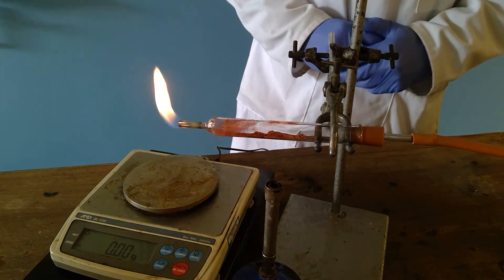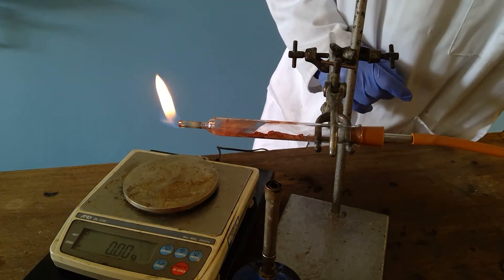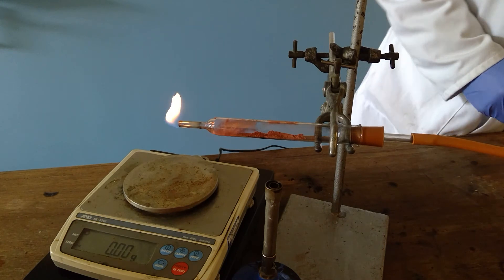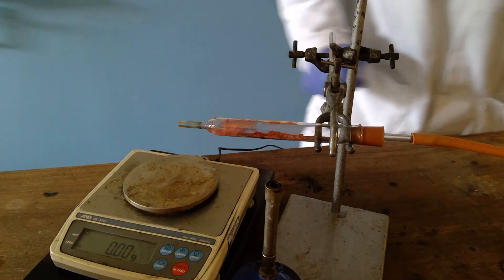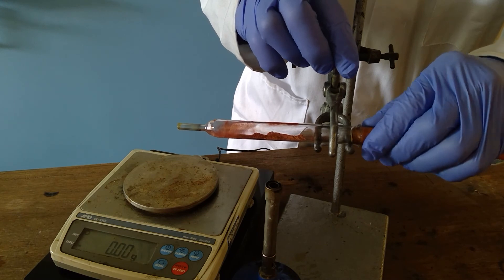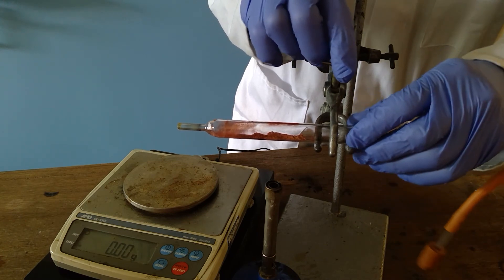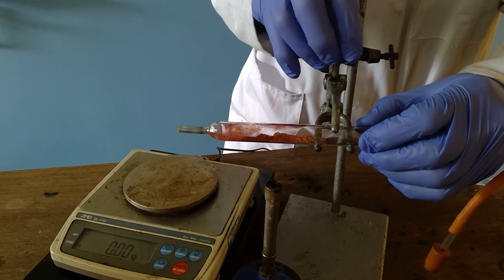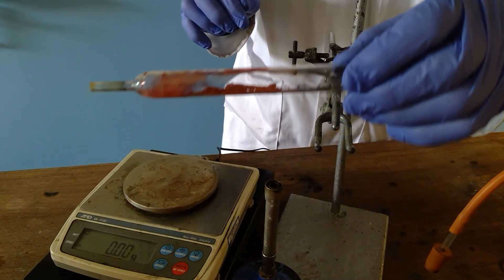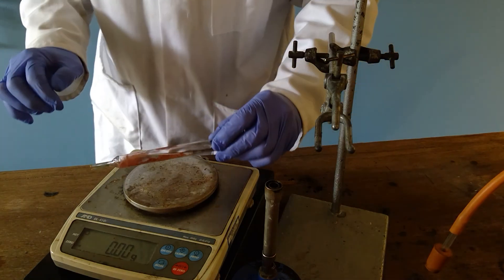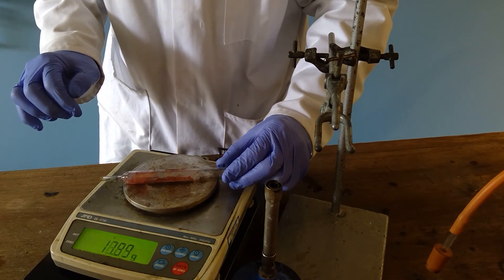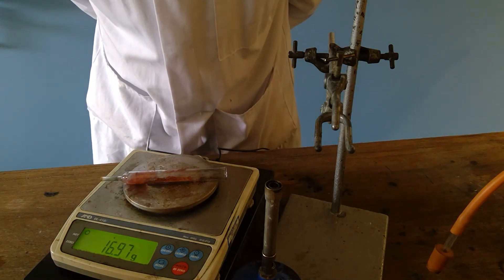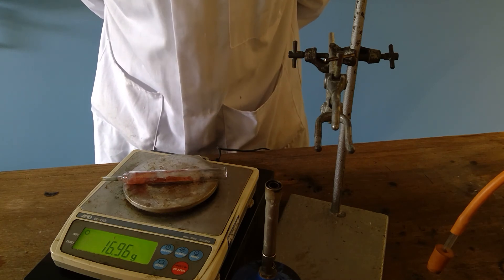We will try after that relatively short period of cooling so we will turn the hydrogen gas out and I will weigh the combustion tube with the copper in. As you can see plenty of copper has been formed. So it is certainly true copper oxide plus hydrogen produces copper and the other product is of course H2O in the gaseous state. And so if you would like to take that final reading, that is the mass of the combustion tube and the copper that we have produced.